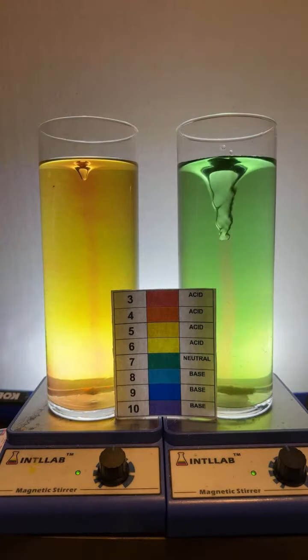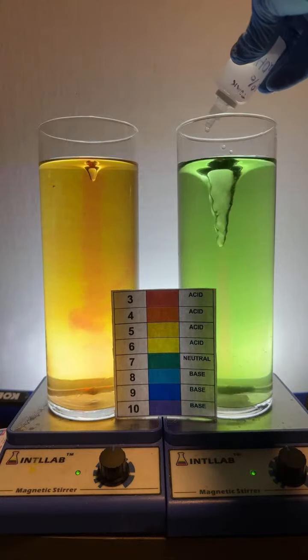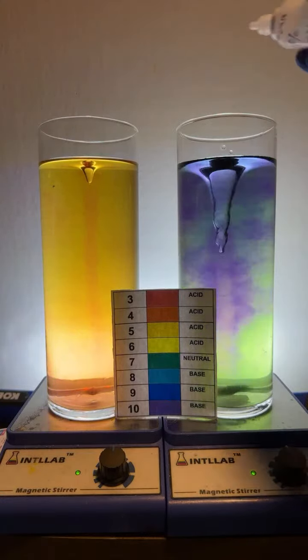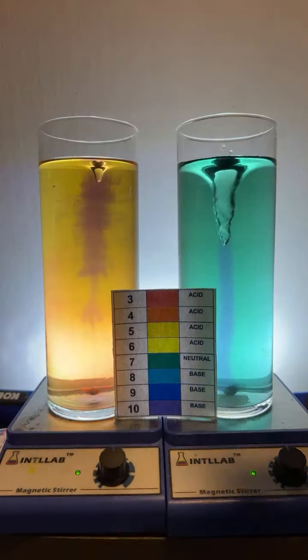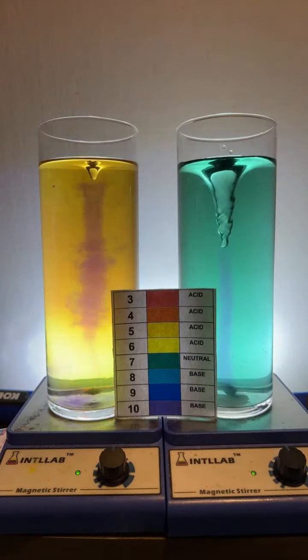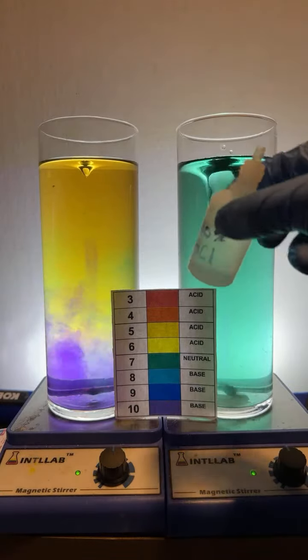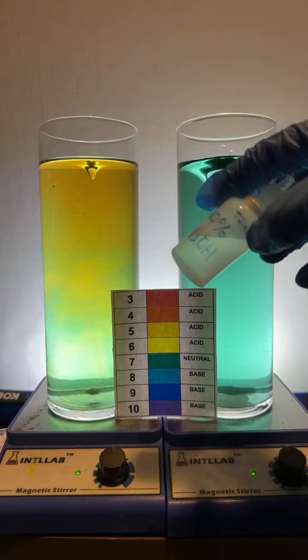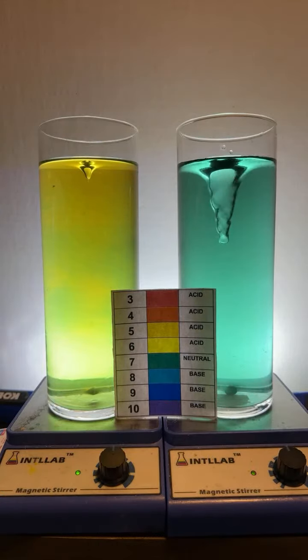There are some acidic compounds that are necessary for life that, if dissolved in solution, have a fairly low pH, like ascorbic acid. That's vitamin C. You need that to survive. There's a bunch of other acids that you need to survive as well. Generally speaking, though, I wear gloves with this stuff because the pH is quite low, and gloves with this because the pH is quite high. I'm going to say once you get below about pH 1, or the base is about pH 12, then I'm a little worried about it.